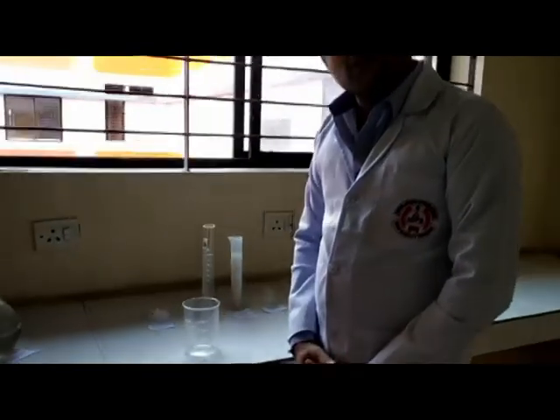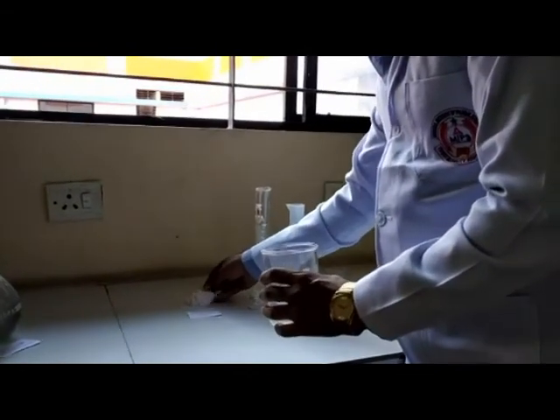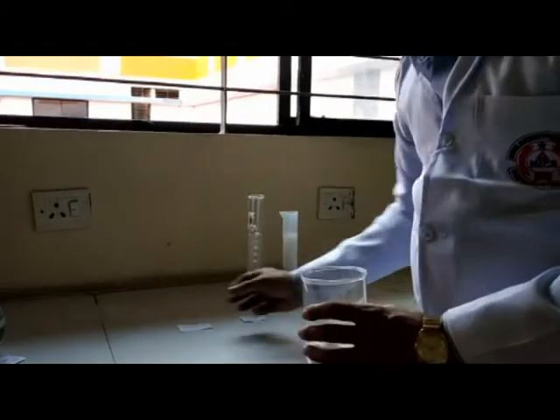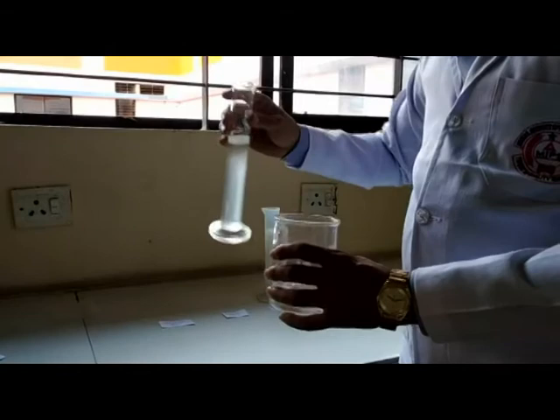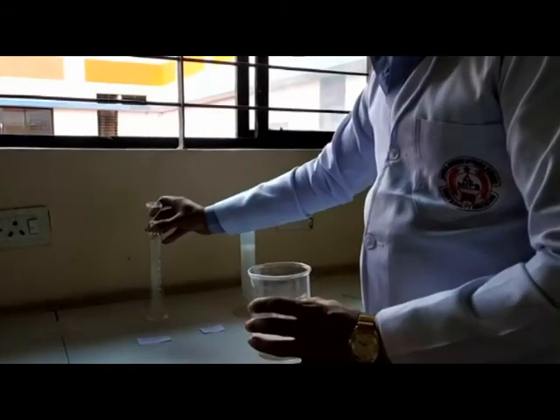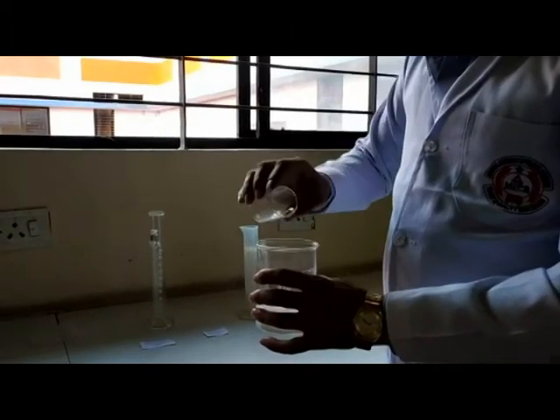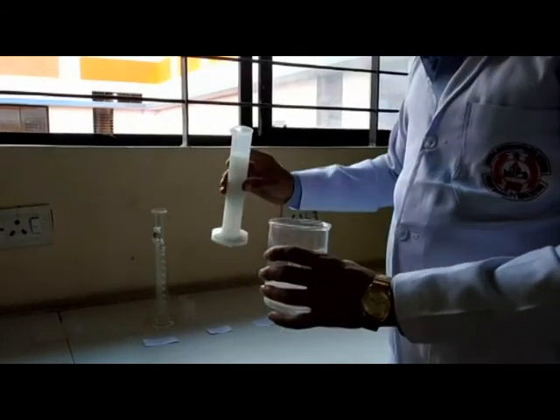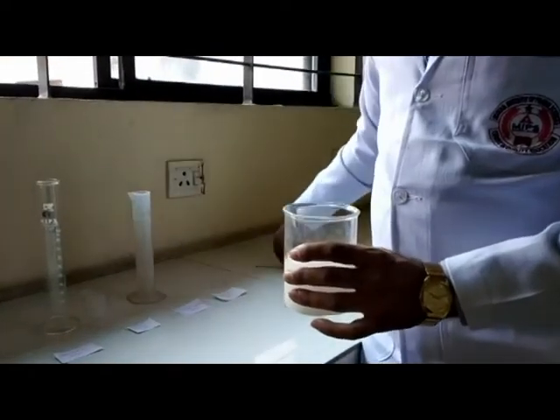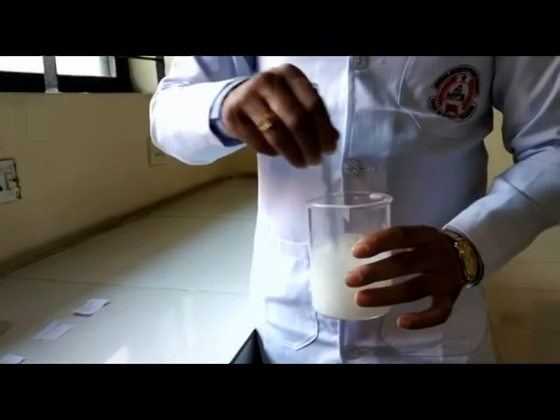Let us perform our practical. In step one, a weighed quantity of paracetamol is taken in a beaker. 100 ml of ethanol is added, followed by 20 ml of chloroform spirit and 100 ml of propylene glycol, with continuous stirring.